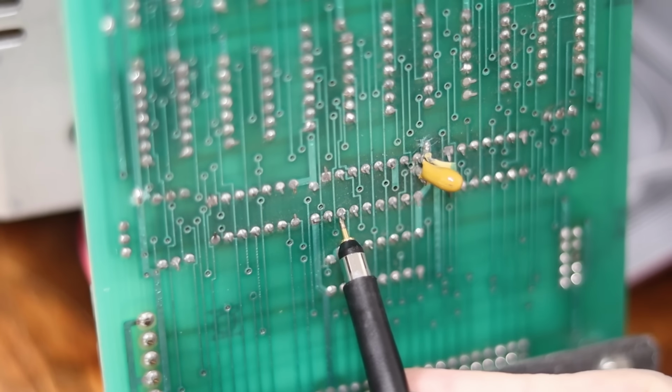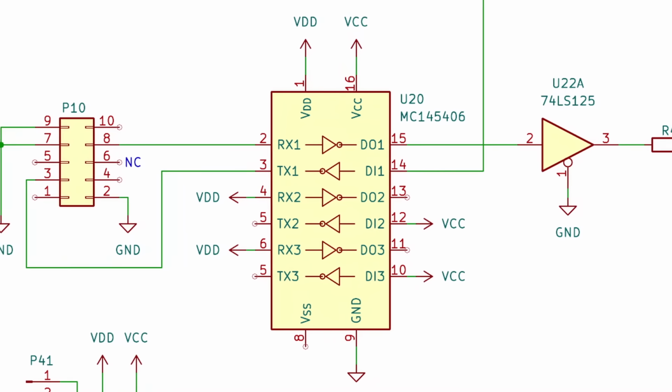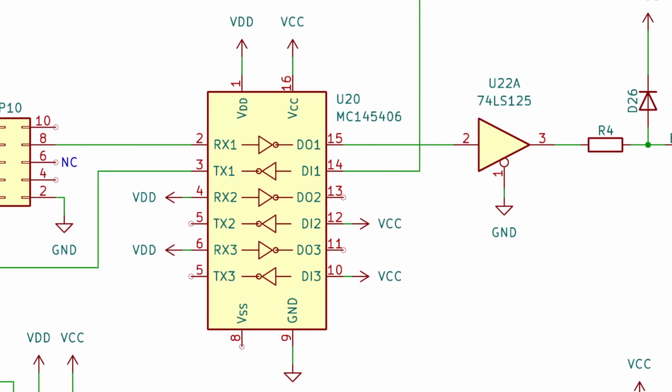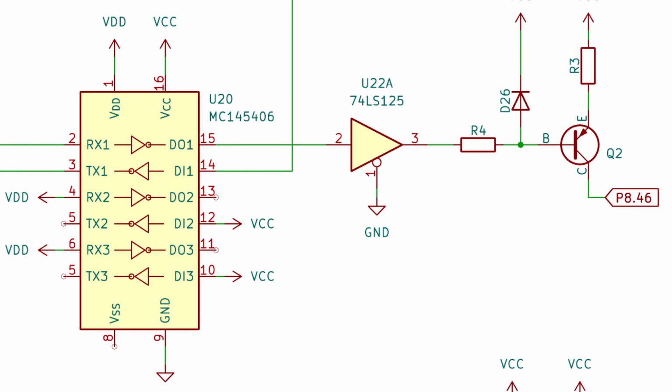I mucked around with it a little bit more off camera, and once I got the scope probe cleanly through the oxidation layer on pin 15 here, the signal came through clean. So the RS-232 driver receiver chip there, I think, is working totally fine. Now there's a couple of things after that. There's a buffer and then a PNP transistor to transmit it down the cable over to the Bomem, and those could be bad, but I started thinking about this.